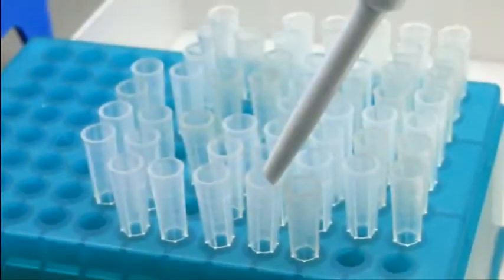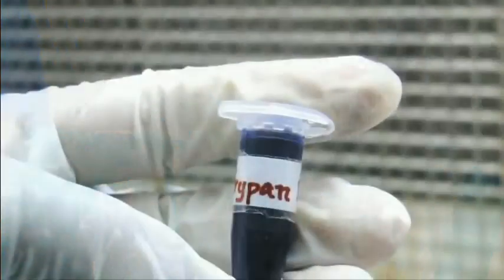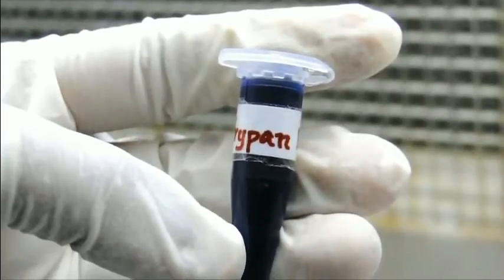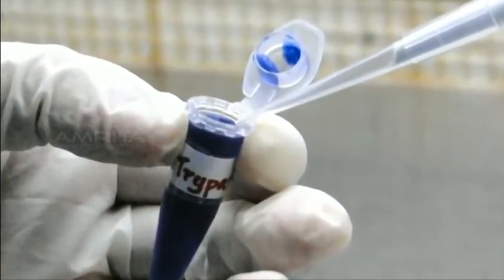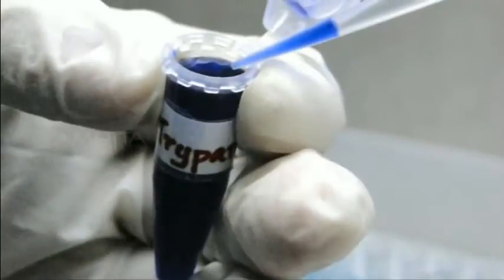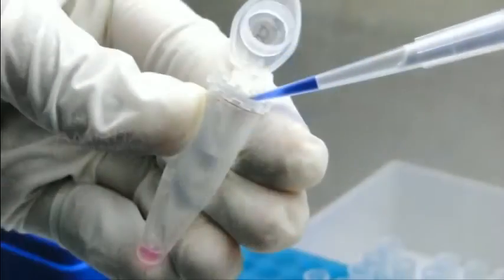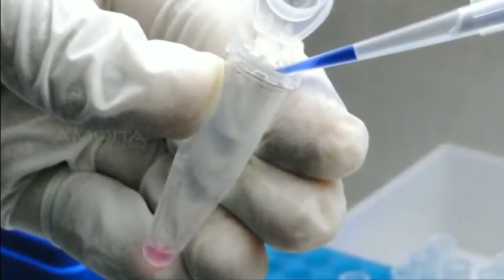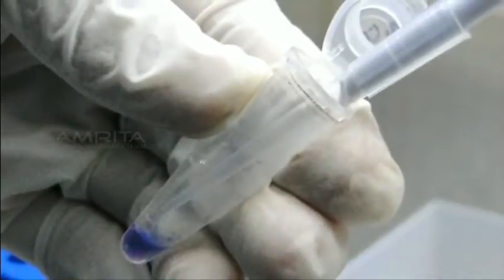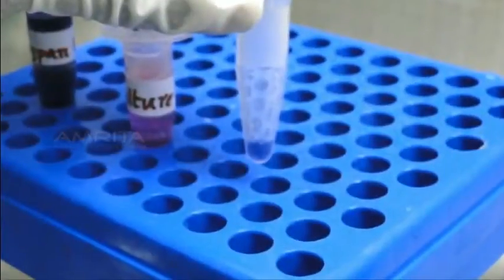Dispose the used pipette tip and insert a new pipette tip to the micro pipette. Now take the vial containing trypan blue dye, open it, and mix 2-3 times with the micro pipette. Take 10 µL of trypan blue solution and transfer it to the vial containing 10 µL of cell suspension. With the micro pipette, mix the trypan blue cell suspension and keep the vials for 5-15 minutes.